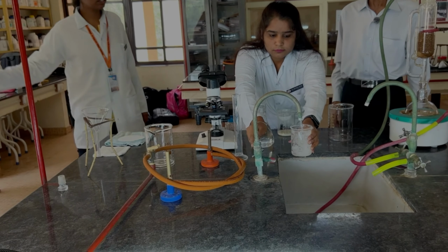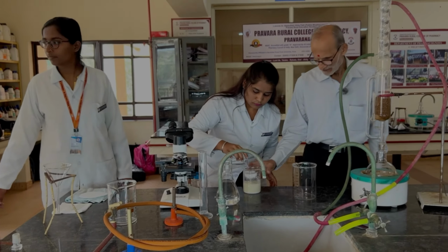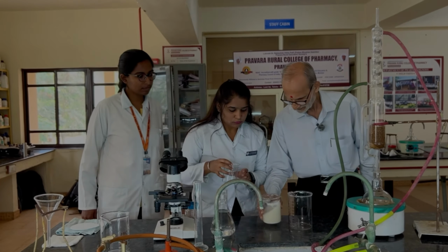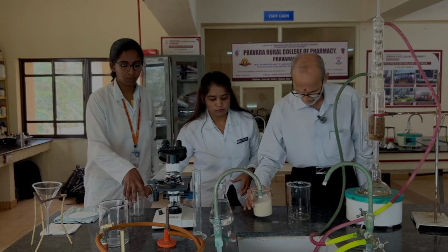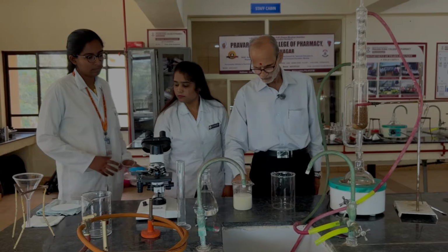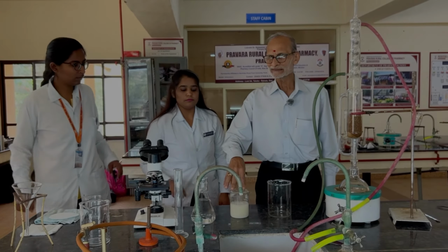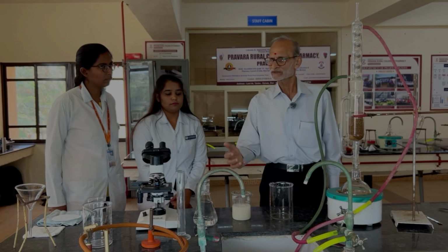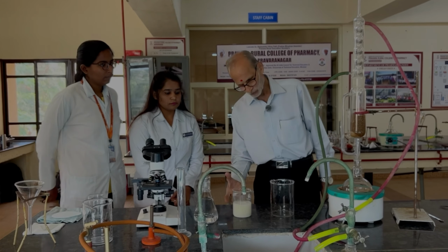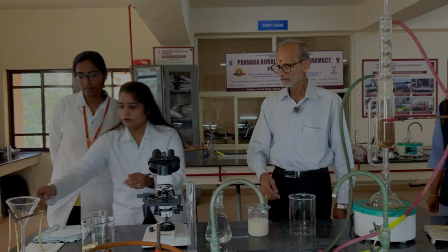We'll give one more washing with the water. Okay, enough. So now we have removed the initial water. Now we have put more water. We will allow the starch to settle down. Some cellulosic matter is still there that will float on the surface and we will discard it. And we'll get the pure starch at the base. In the meantime, prepare for the filtration.